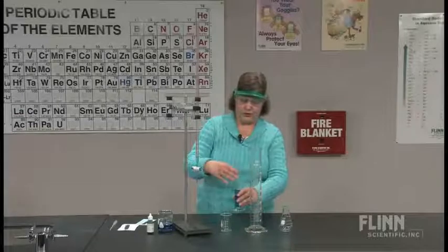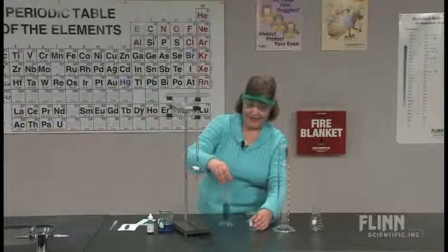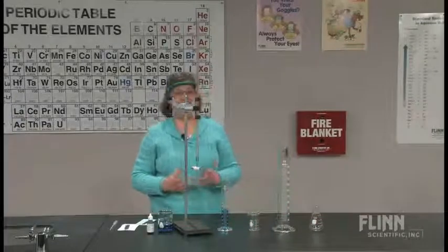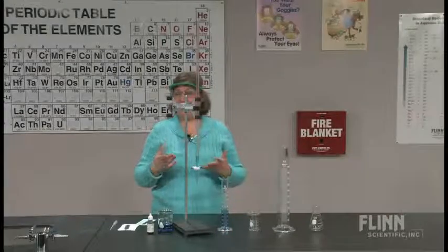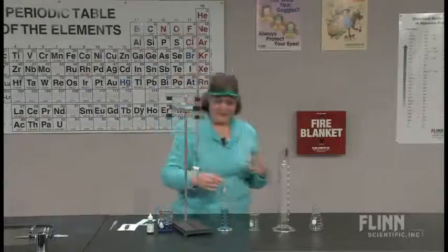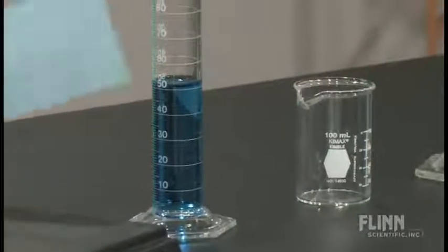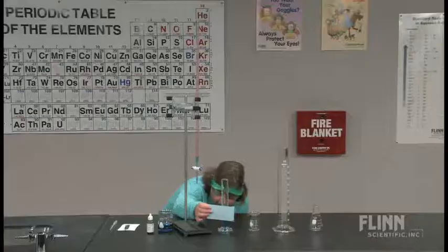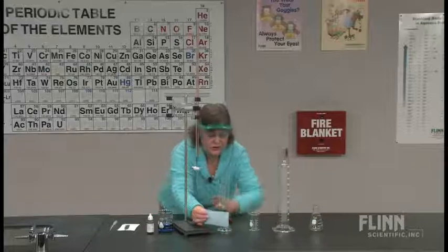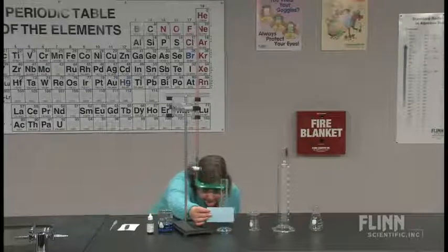And now what I want to do, I'm actually going to move these all down just a little bit, is focus on the volume in that graduated cylinder. And when you can see that volume well, then I'm going to turn it around so that I can read the volume. Okay. And I'm going to use my card as well here, and I'm going to get down at eye level approximately. And what I want to do is read what it says and also what my uncertainty is.